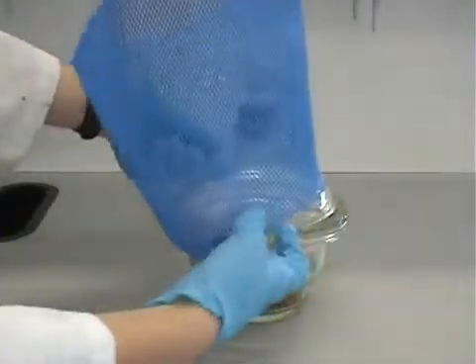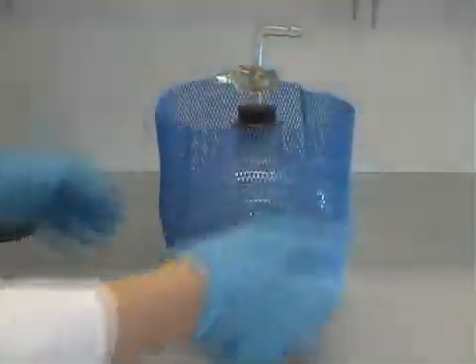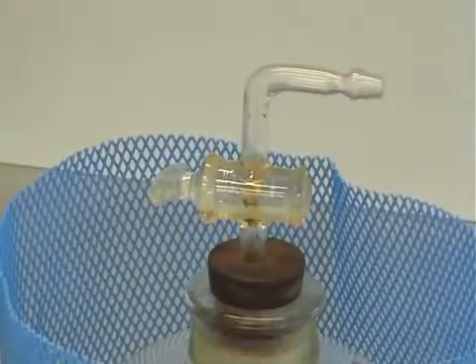And the blue safety netting is put over the desiccator. You should then ensure that the tap at the top of the desiccator is closed.